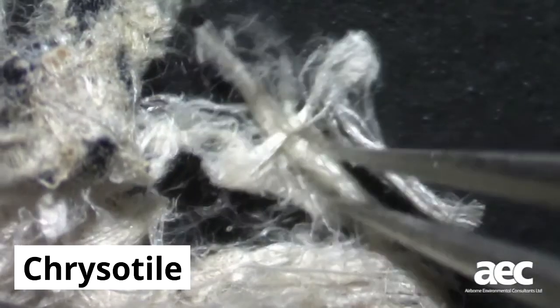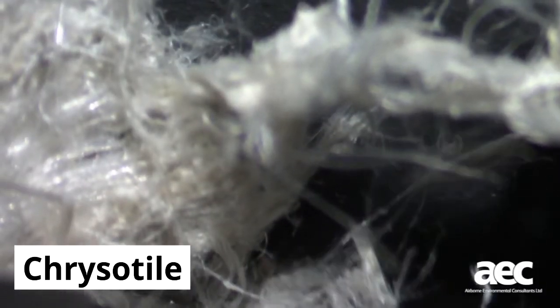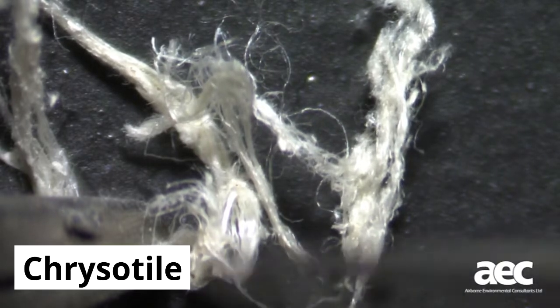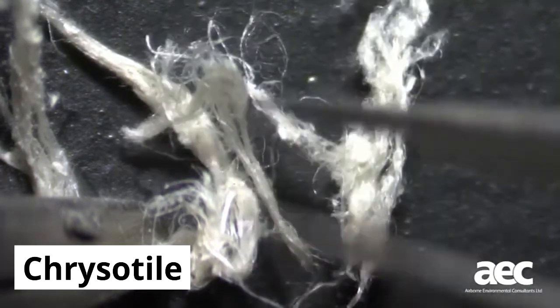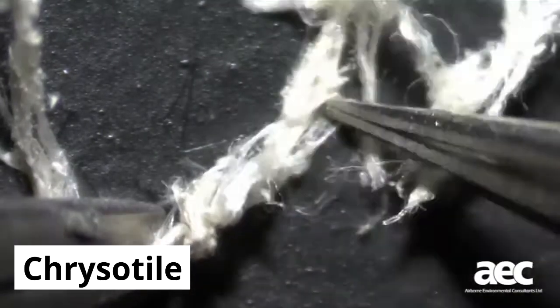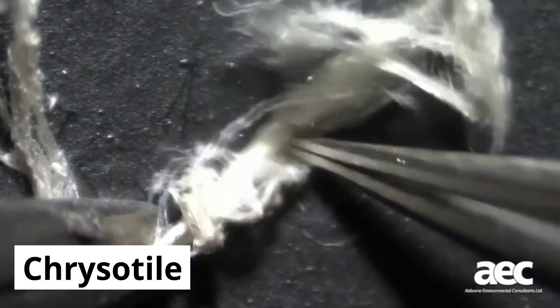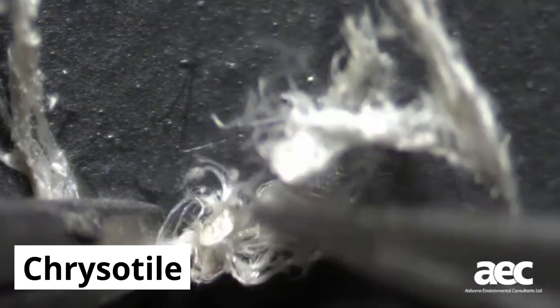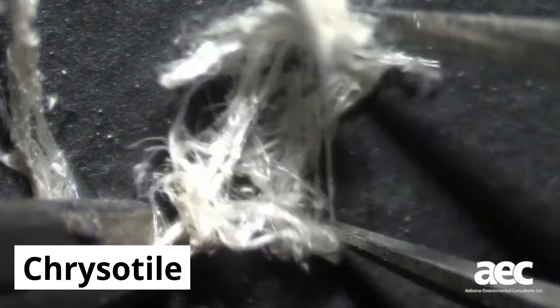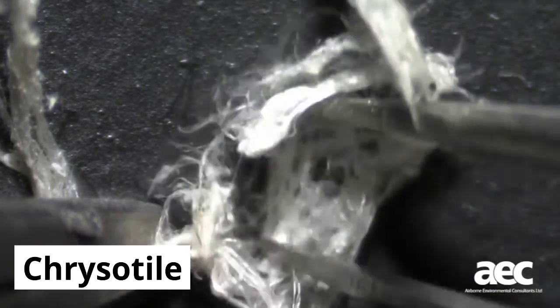These are then assessed for the splitting nature of asbestos and their level of flexibility. Chrysotile also has a very silky surface appearance, which is referred to as its lustre. In all, 7 separate morphological properties are assessed and recorded at this stage.